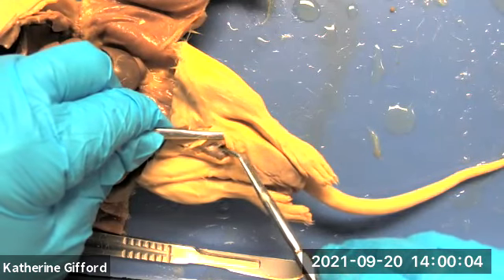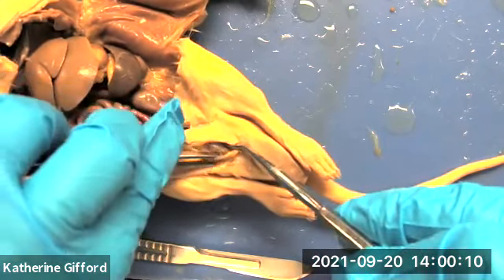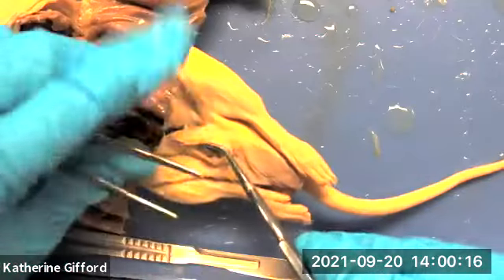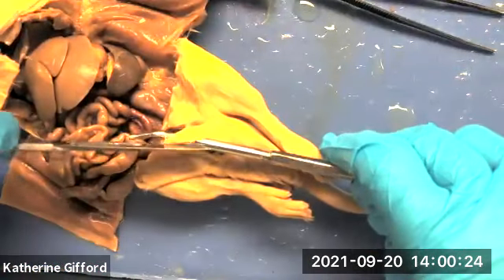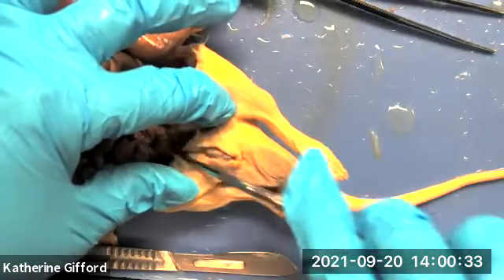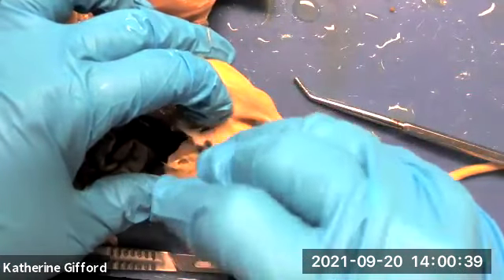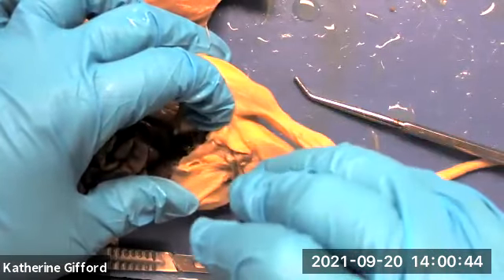The prepuce is deep to the regular skin. The glans penis is the expanded distal end. We can see the body of the penis in this area.